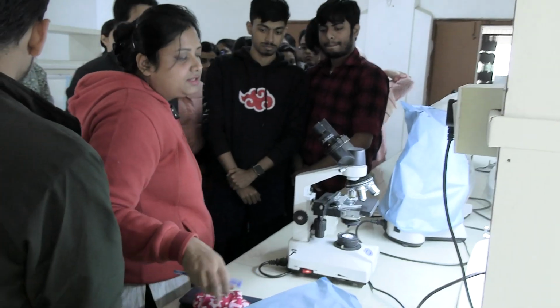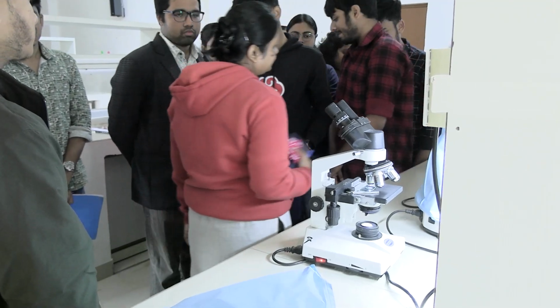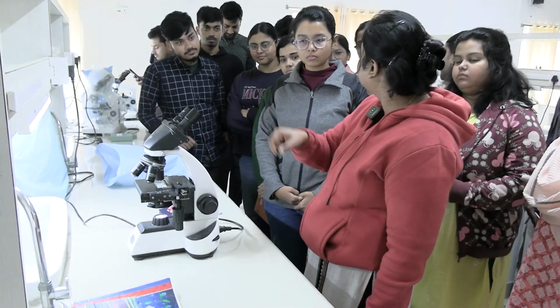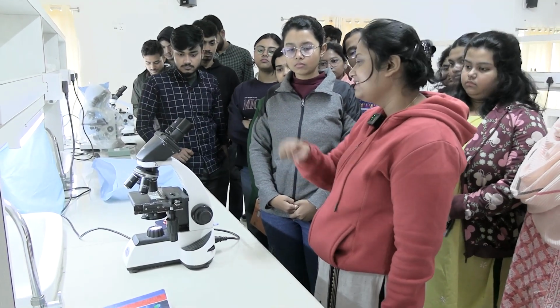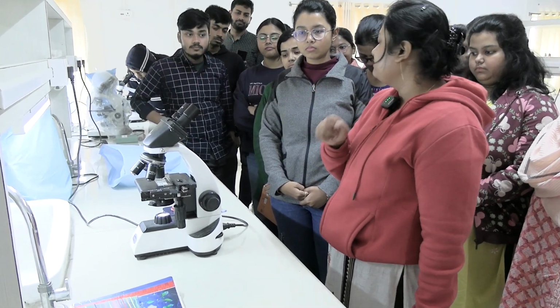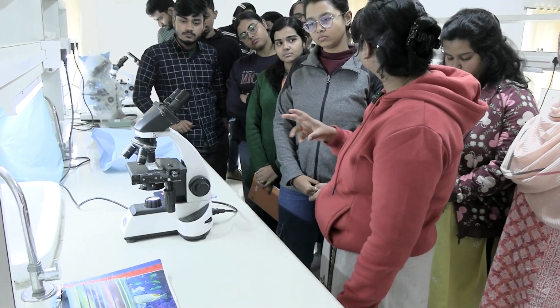Okay. You only move the fine screw, no other thing you touch. White area is the lumen. Then there is the epithelium layer, thick layer. Okay, epithelium is pseudostratified ciliated columnar epithelium with goblet cells. After that, loose connective tissue layer. It is lamina propria and submucosa. Okay, in the submucosa, some glands you can see.